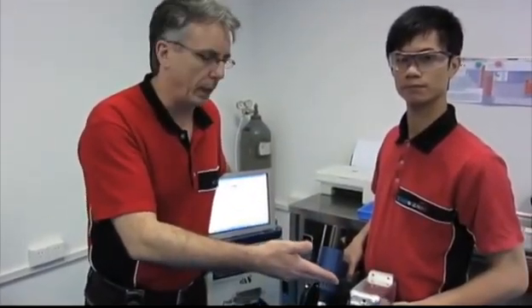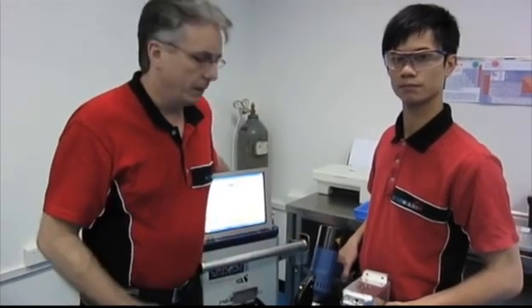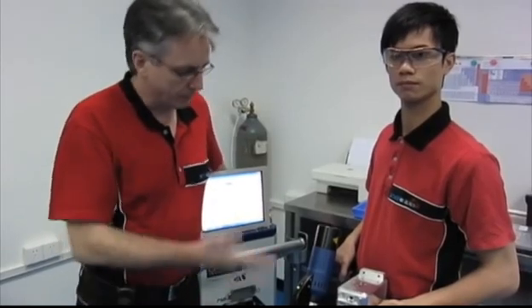This piece of aluminium was delivered to Star Prototype by our supplier as if it were 6061. We're now going to do a test to determine whether or not it is. Go ahead.